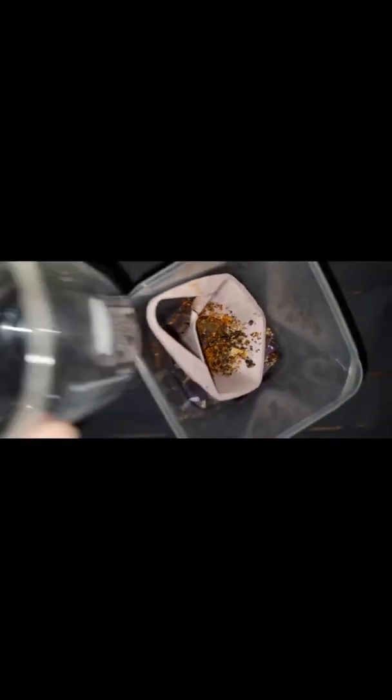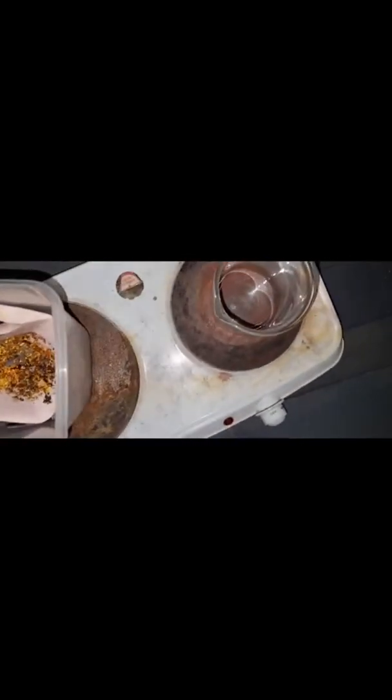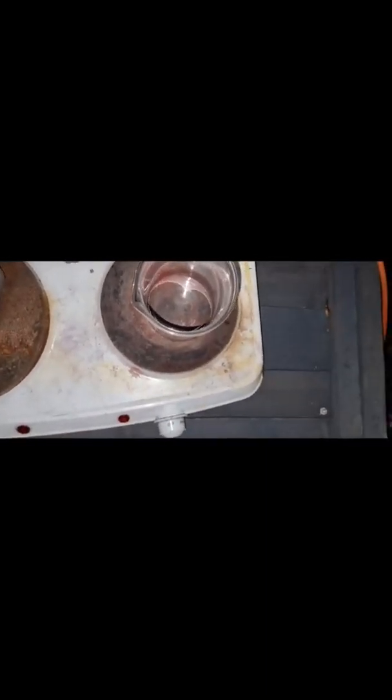So all we're going to do is transfer that over to my new beaker — my other one cracked — and this one's nice and small, so I reckon it's going to be a lot nicer to use. I'm just going to transfer it over like that, throw all this stuff in there. It's going to be a bit of a dirty refine, but I don't think it'll be as bad as some of the previous ones I've done.